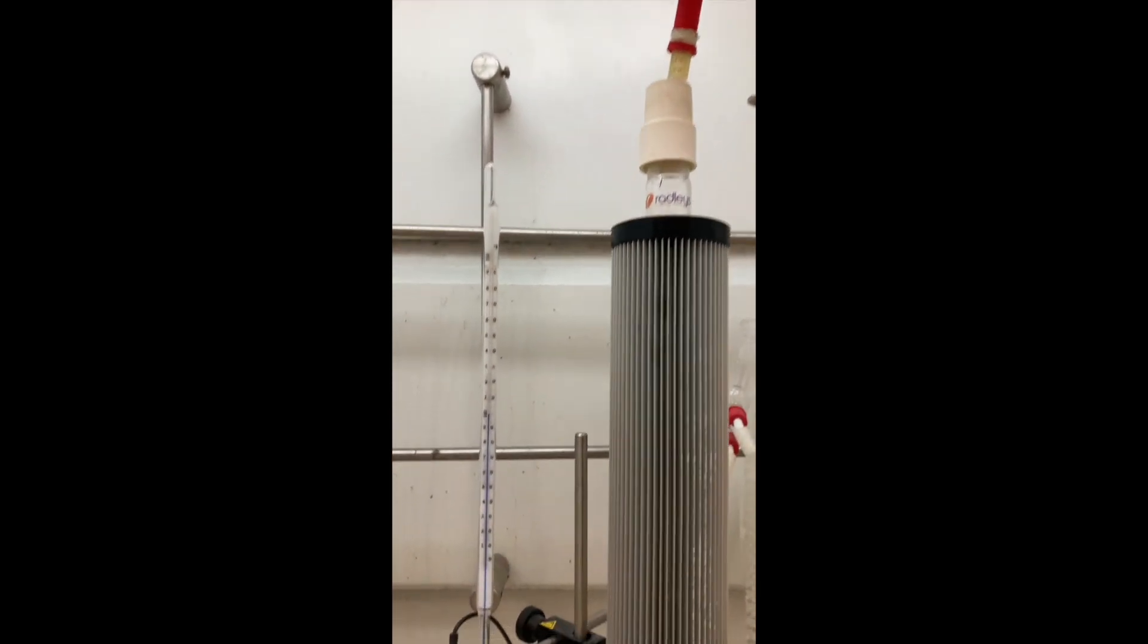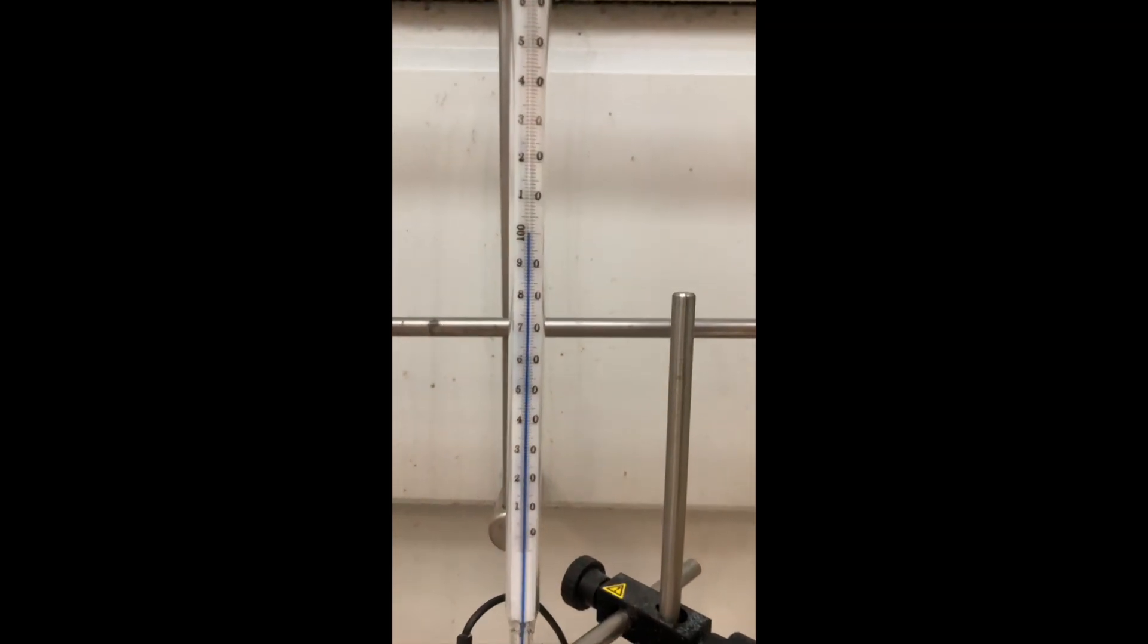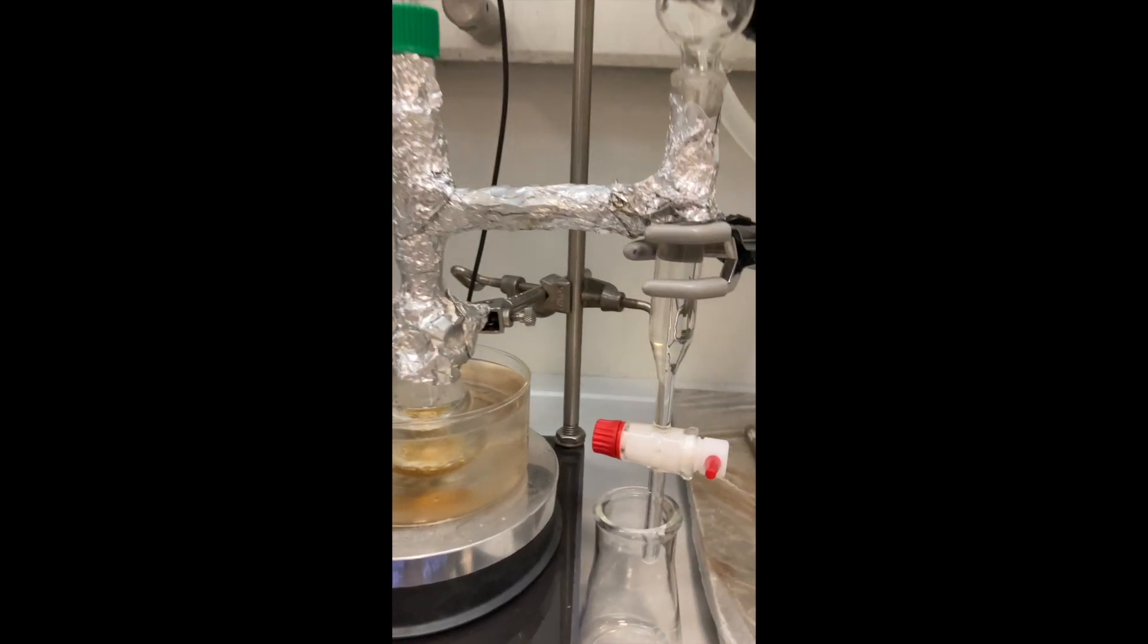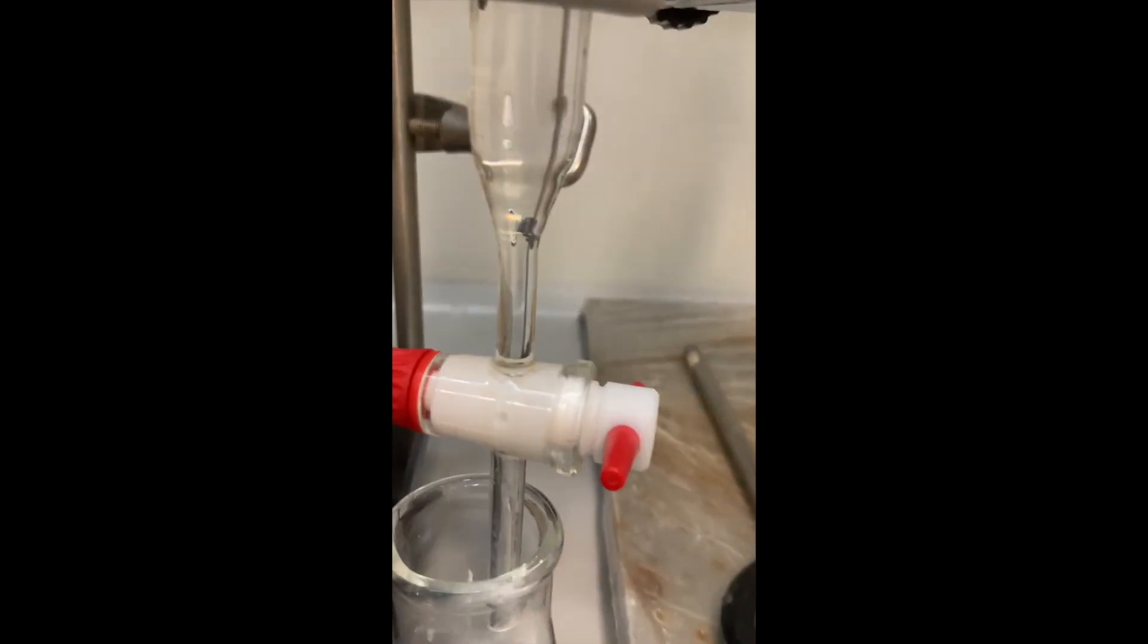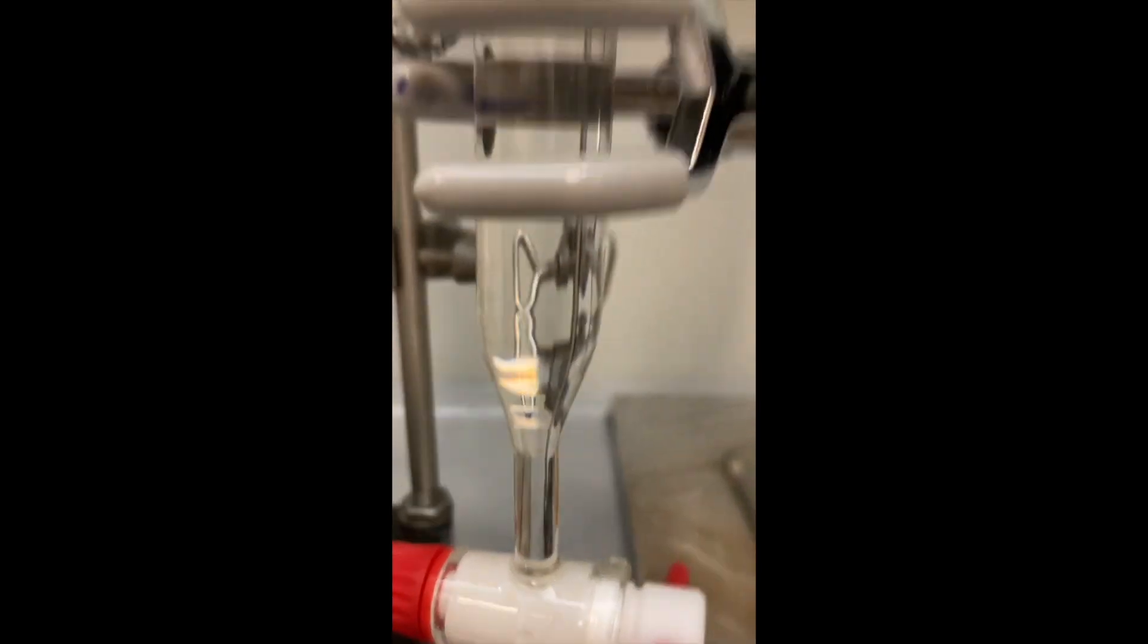The following day, I couldn't see any water at the lower end. The reaction failed.